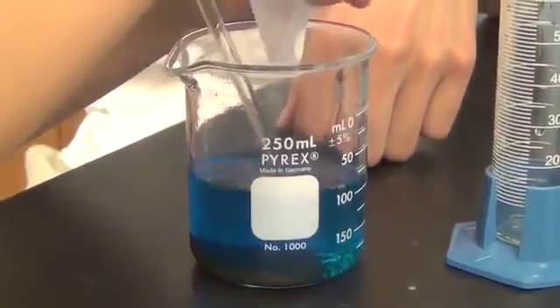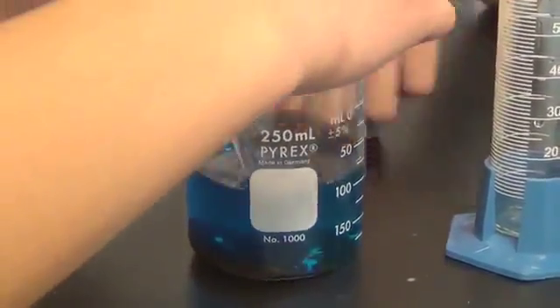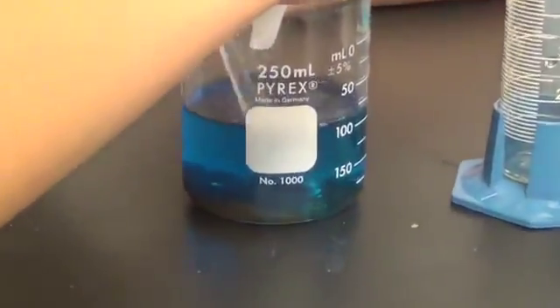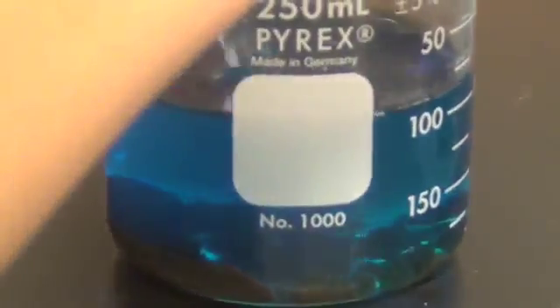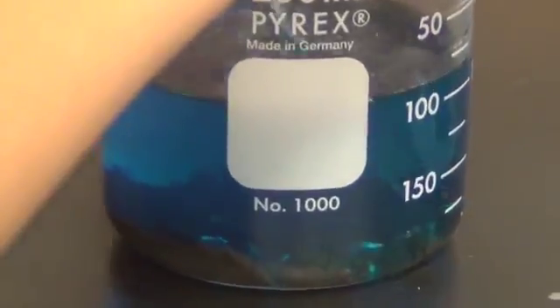What's happening? Wait, something did happen. Go, stir, stir. That worked really fast.